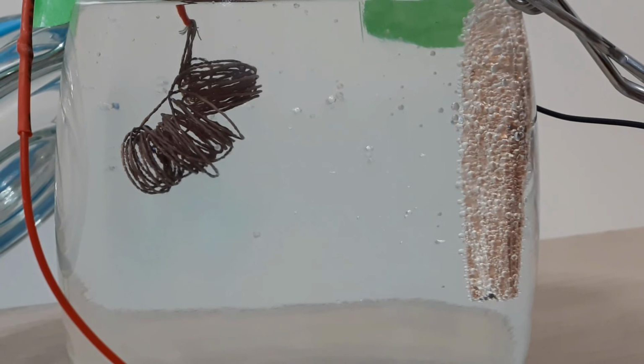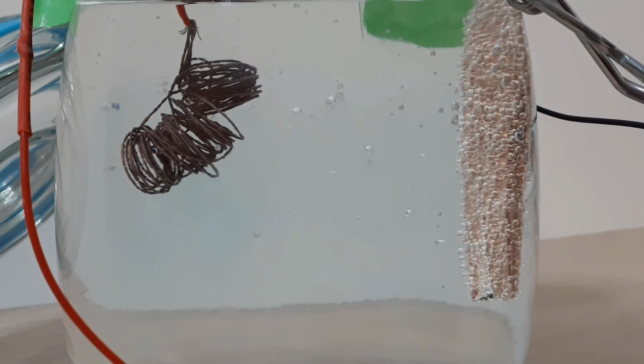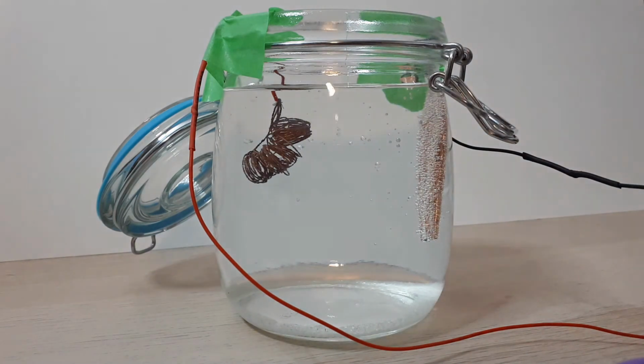One should be producing a great deal more bubbles than the other. In the event that we are not certain which scrap is the cathode or anode, we can use this opportunity to assess that there is hydrogen evolution occurring at the cathode. We will need to remember which scrap is the cathode. This setup will be left for about 2 hours or until the solution takes on a blue tinge, which indicates dissolved copper in the solution.